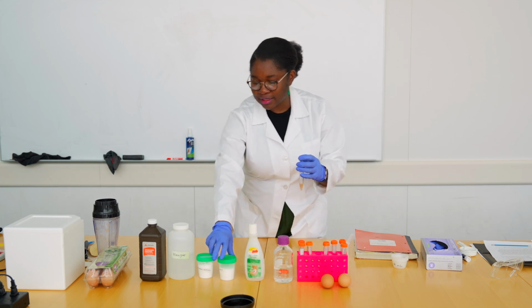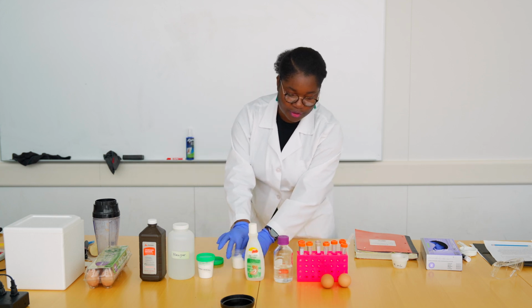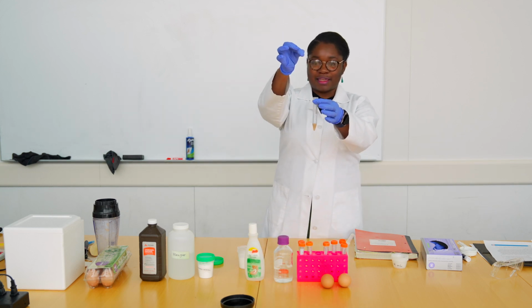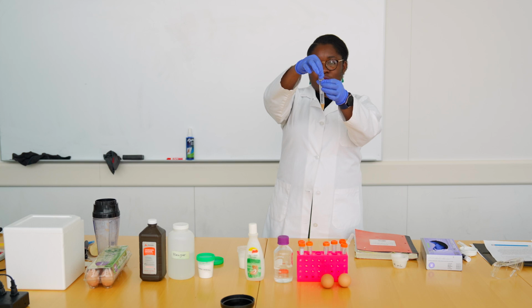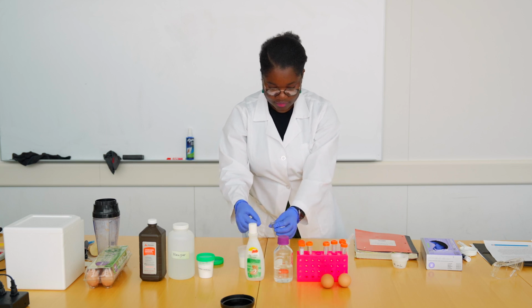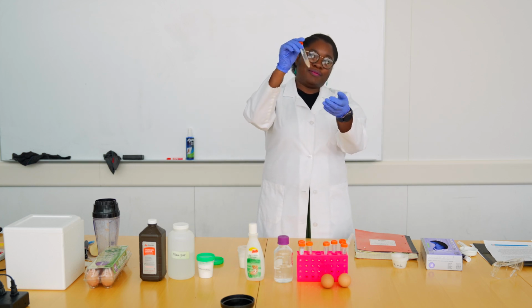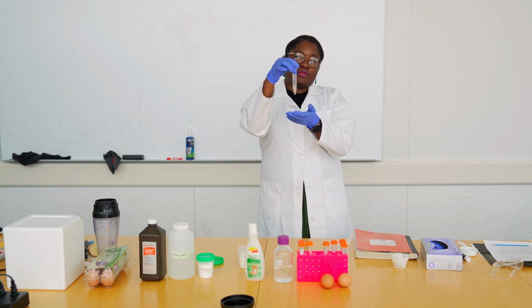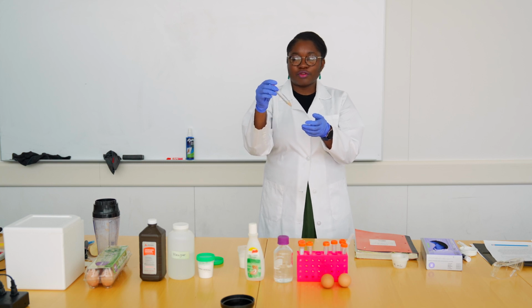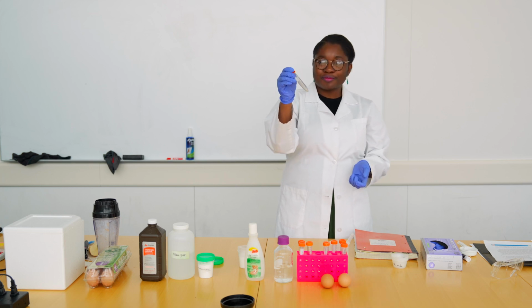And to this, you could add some salt and observe how it reacts differently compared to your hydrogen peroxide. So I have my salt in here. I have my potato juice. Just dropping about a pinch of salt. Close your tube. Mix it up. Make sure that the salt is dissolved. And if you could avoid having bubbles in there, that would be fine. One way of doing that would just be inverting the tube like so.